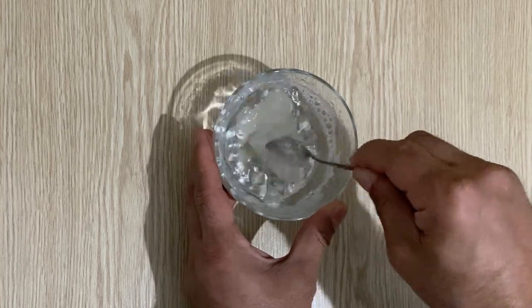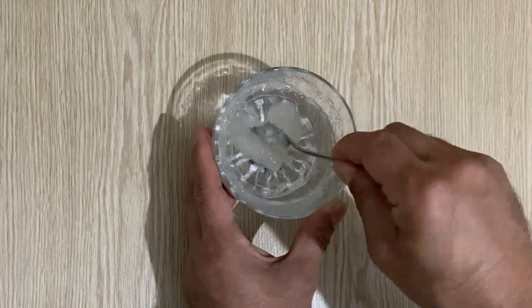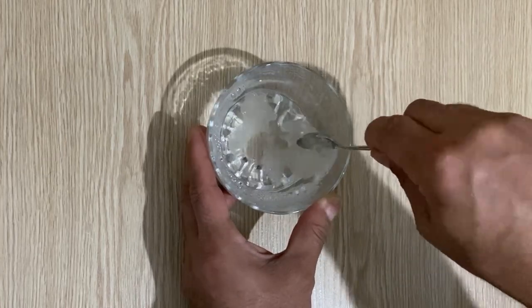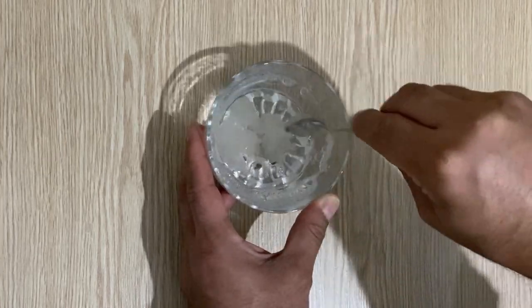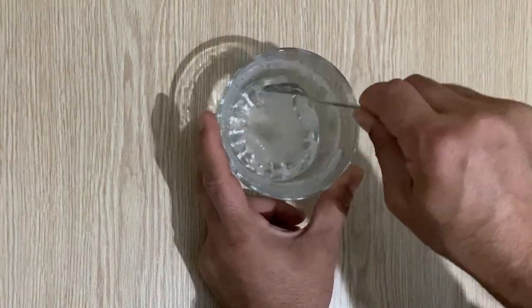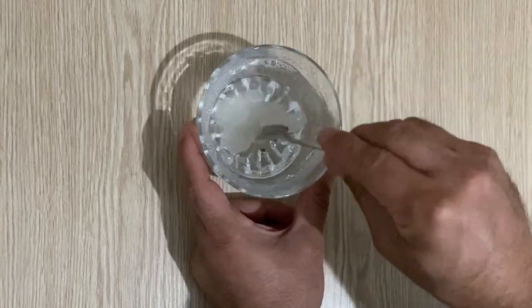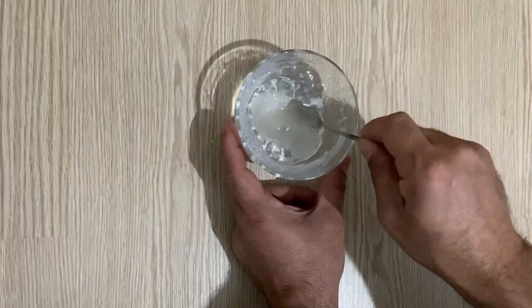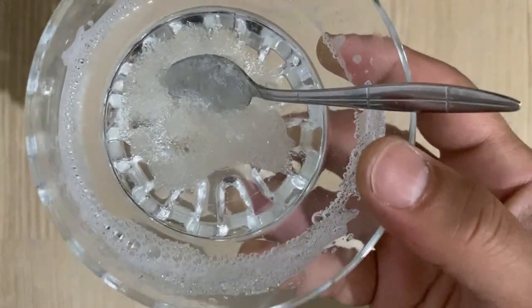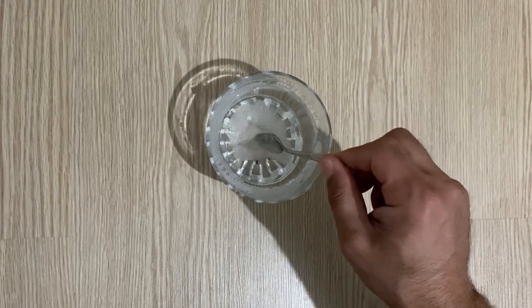As you can see, it's not very easy to dissolve polyvinyl alcohol in water, so we have to wait for about one or two days. It's a little bit dissolved now. I will put it away for one or two days, and after it completely dissolves I will show you the result.